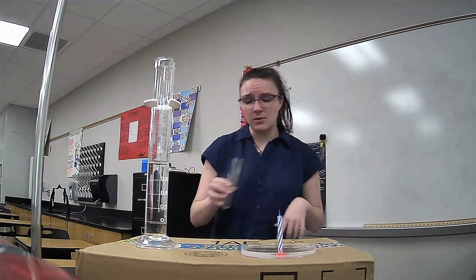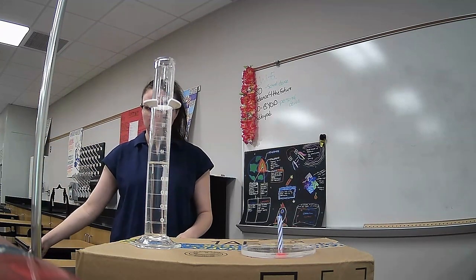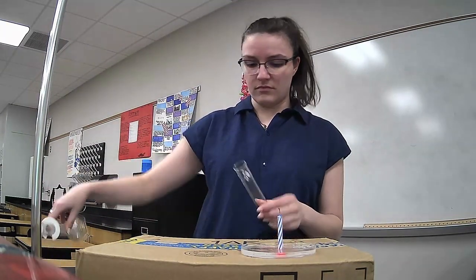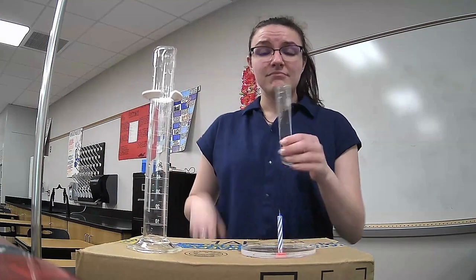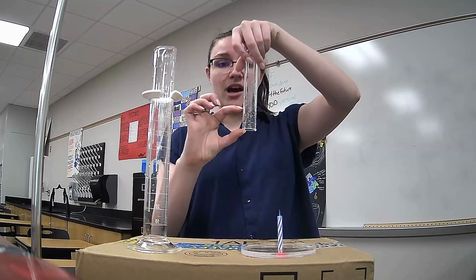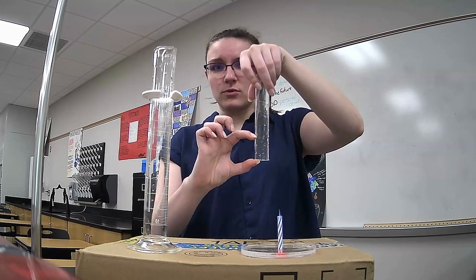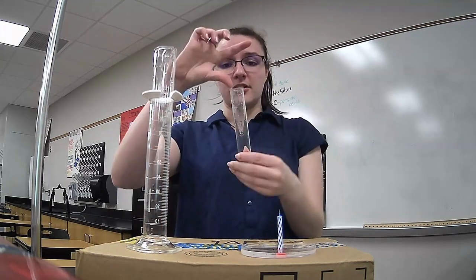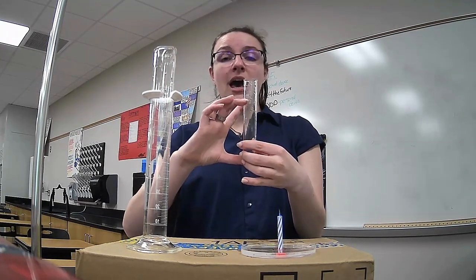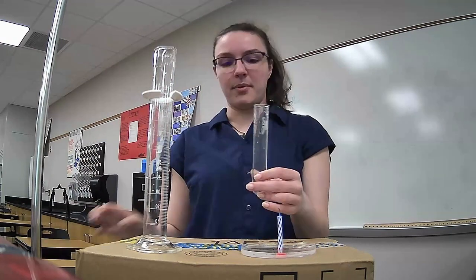I'm going to rinse this out because I don't want any smoke in it. And now I want to know just what this volume is, because remember here it was upside down. I went up to my orange line, but I can't measure just this amount using water. So instead, I'm going to turn it right side up. I'm going to measure this whole bottom volume up to my orange line and then subtract so that I can get just the top portion.